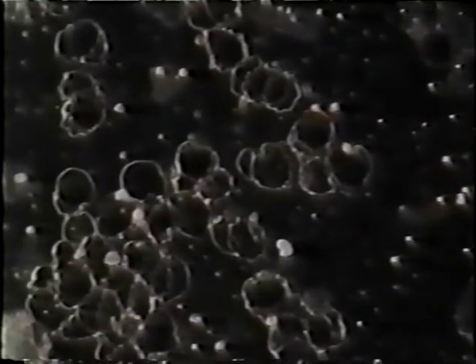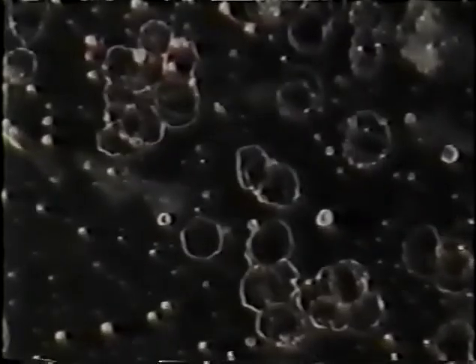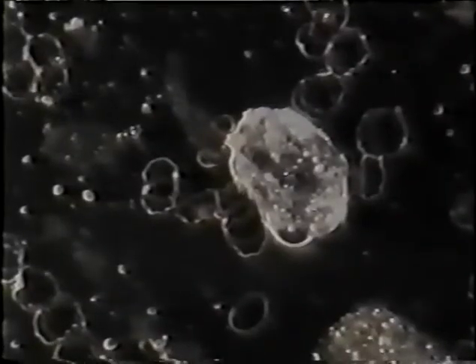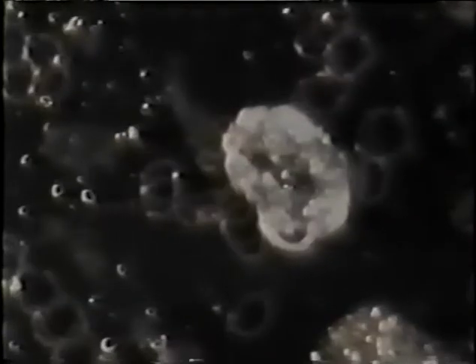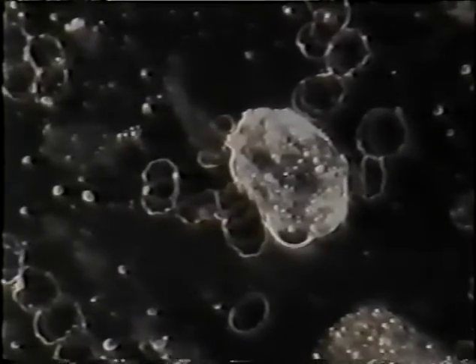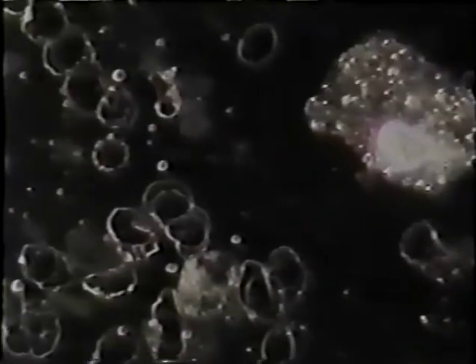Now, this is after fellow's second exposure to the device. You can see the amount of cellular debris has picked up considerably. There's larger cells, there's more cells. There's just generally quite a bit more debris within the blood here. At this point, it was recommended that he not use the device for several days in order to let his blood clear itself of all this debris.